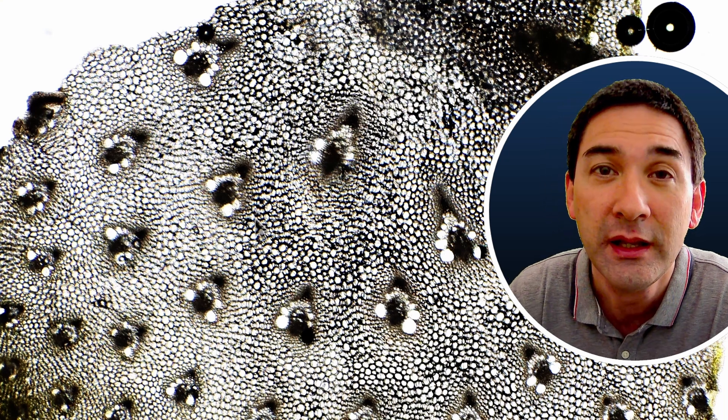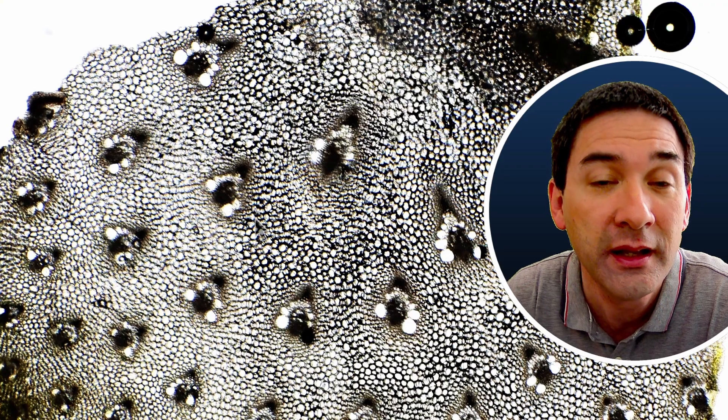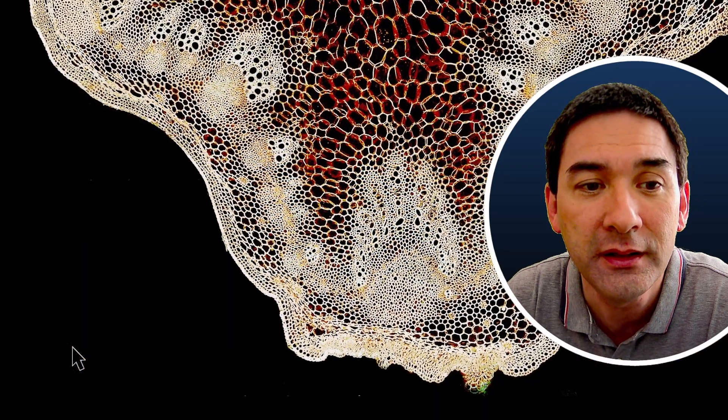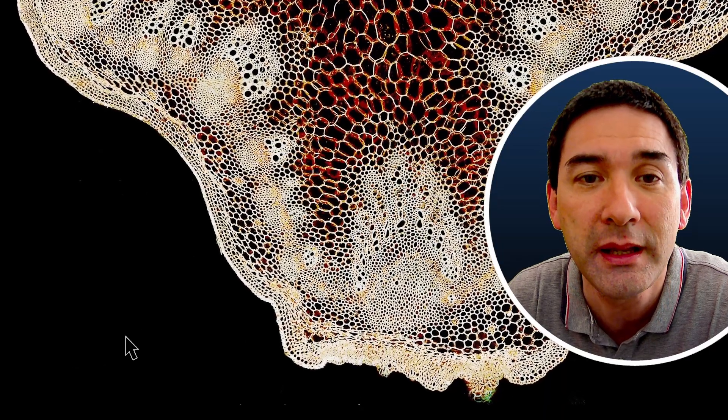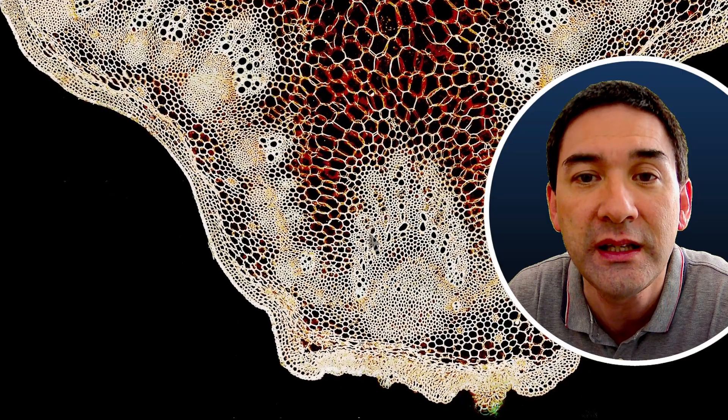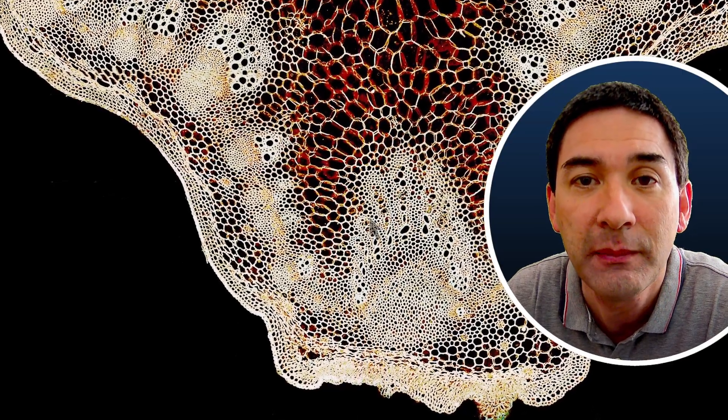If this is a monocot, what about a dicot? I have a cross-section of a sunflower here - it's one of my first images that I made. Here you can also see the vascular bundles, but they're now arranged in a circle - usually on the outside. In the center you do not find those vascular bundles. Here you can see that the xylem and phloem are arranged on the outside, on the periphery of the stem. That's the typical dicot arrangement.